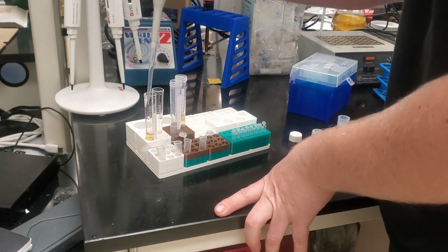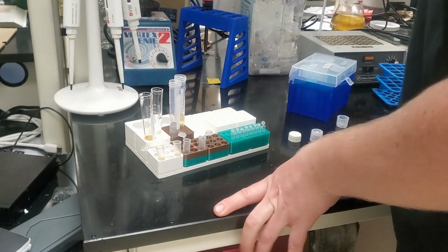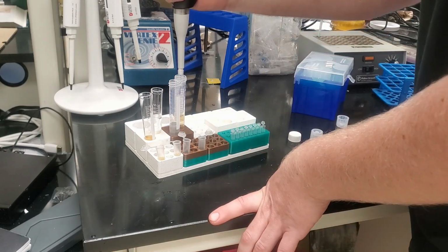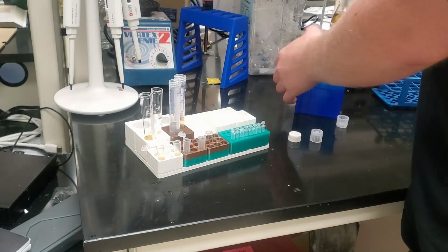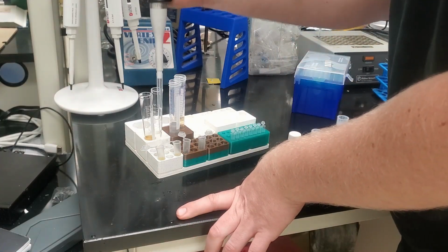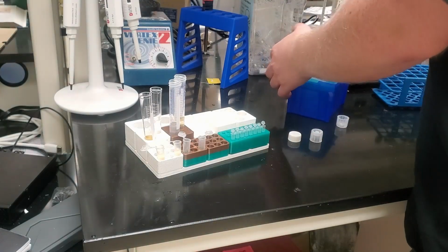And here we are with the most practical thing that I have ever made, possibly in my life, definitely on this channel, the fully modular tube rack. Allowing me to work with different sizes of tubes for different levels of sample preparation, all right from the same tube rack, easily portable, easily movable, all right in one simple piece of equipment.